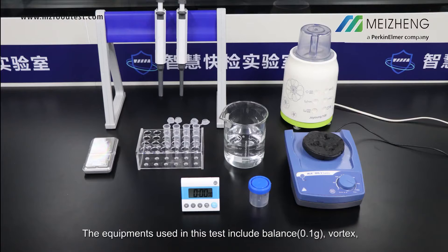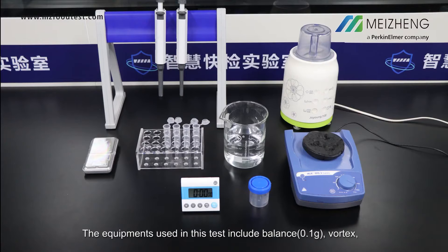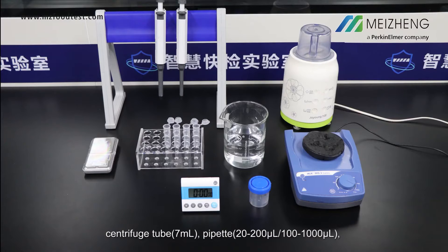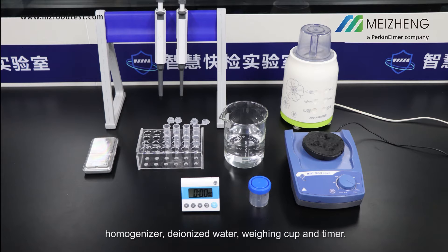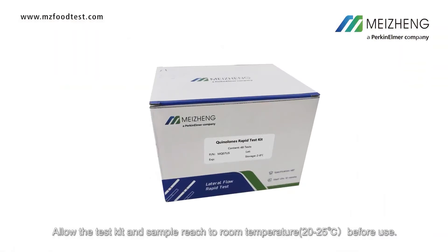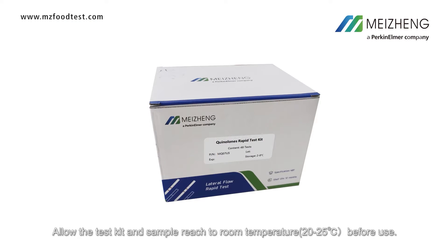Preparations. The equipment used in this test includes balance, vortex, centrifuge tube, pipette, homogenizer, deionized water, weighing cup, and timer. Allow the test kit and sample to reach room temperature before use.